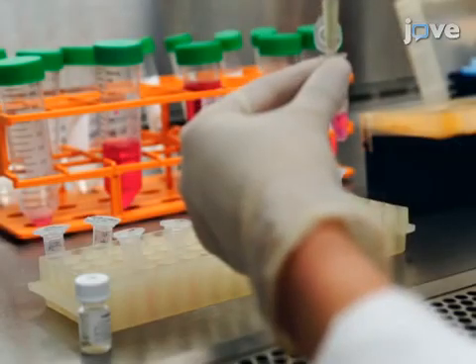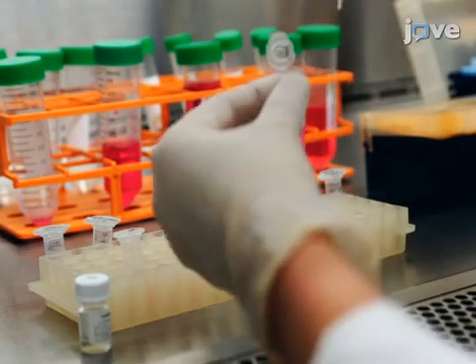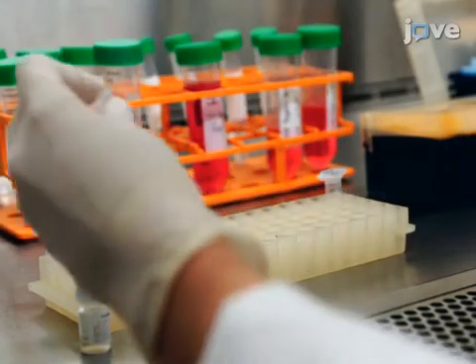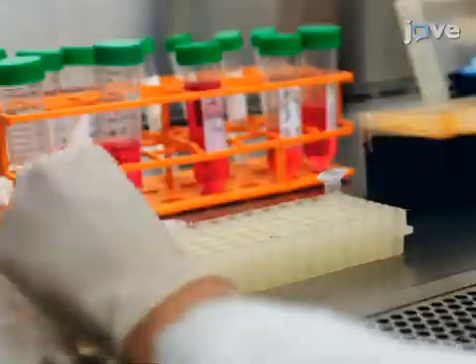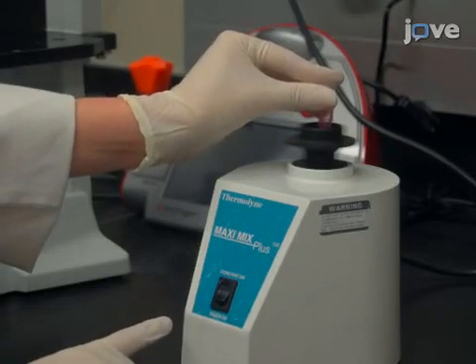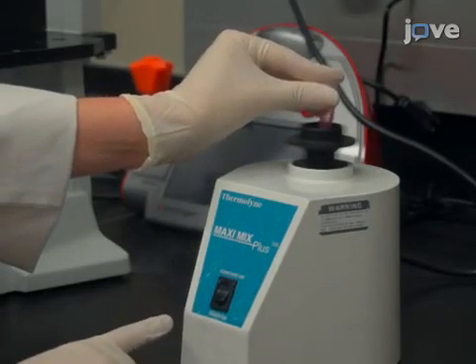Next, add 6 microliters of room-temperature transfection reagent to the medium and immediately vortex the solution for 30 seconds.